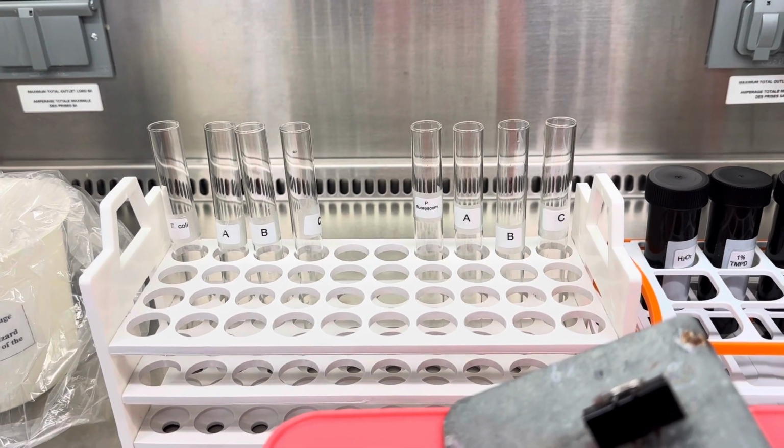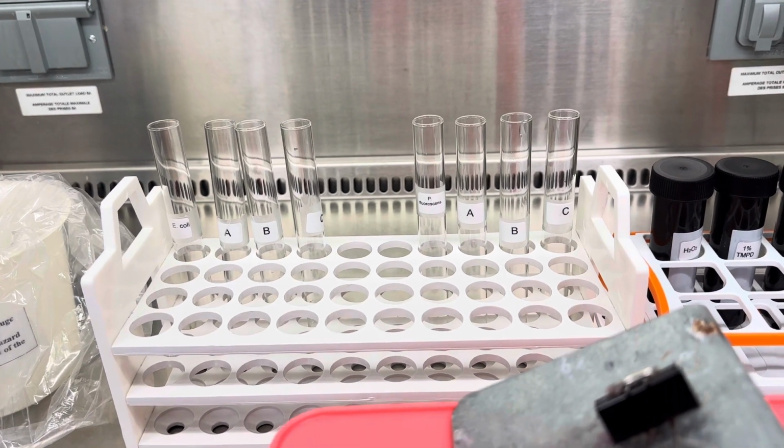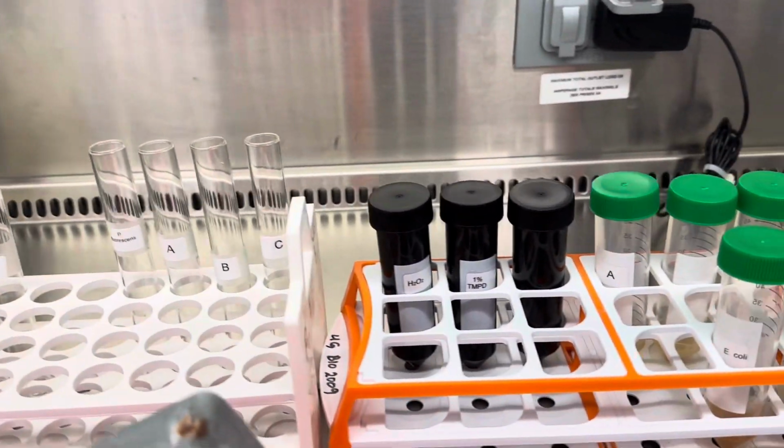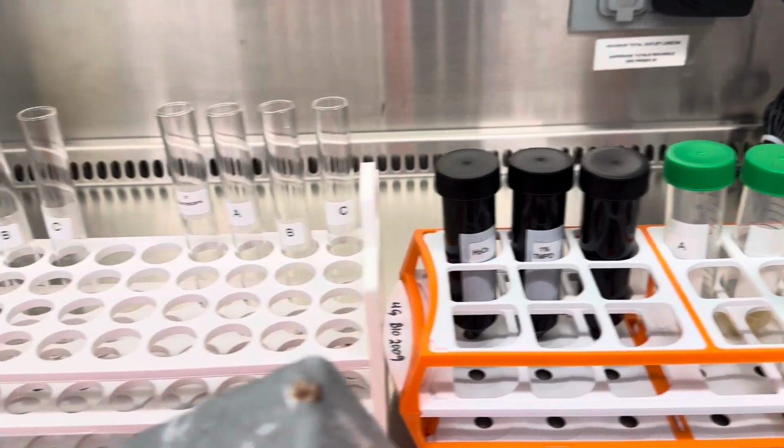Good morning, everybody. I was asked by Dr. Kotra to just do the catalase and the oxidase experiments because you did not get to finish your meat lab, okay? So let me just guide you through it here.